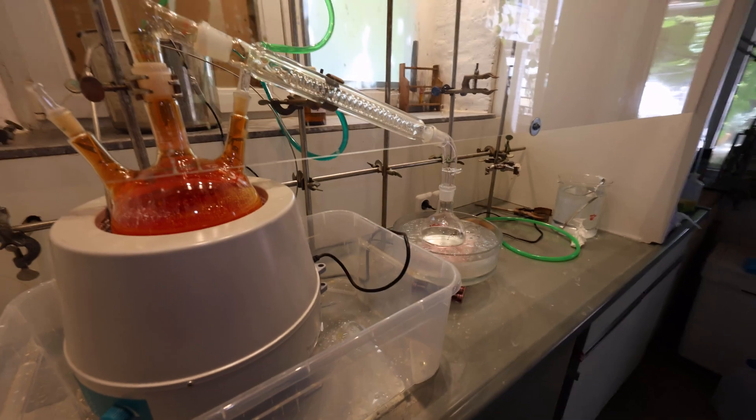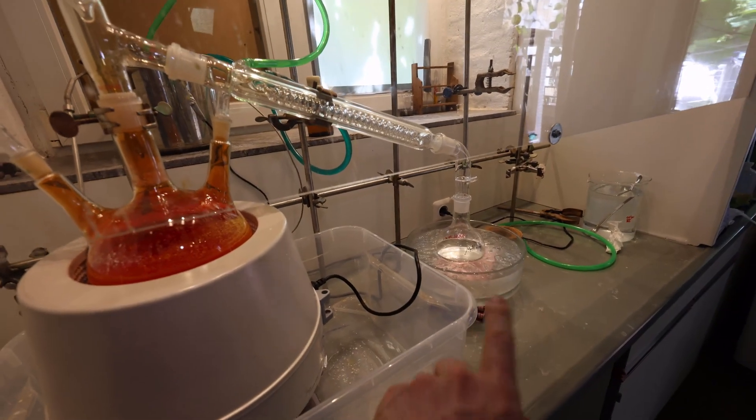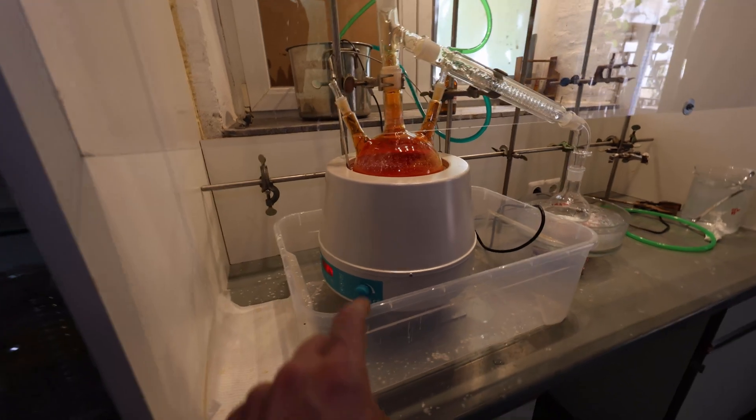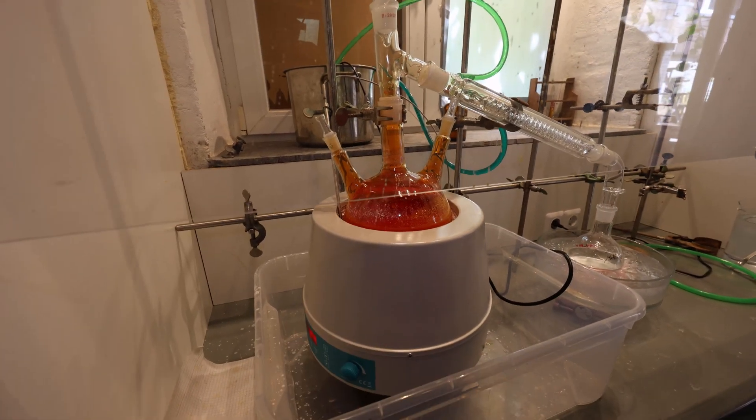We put the receiving flask under ice and now we're going to turn up the heat to start distilling it over.